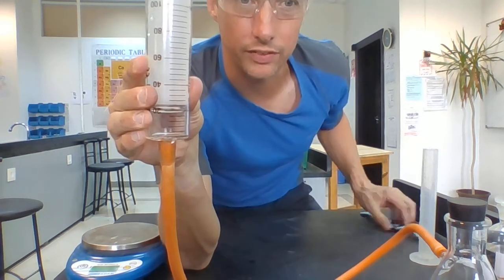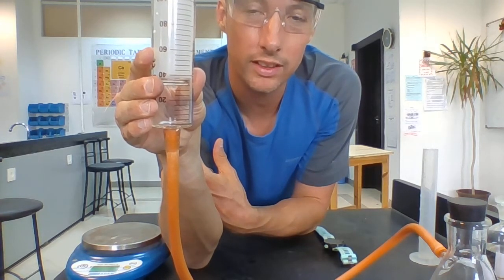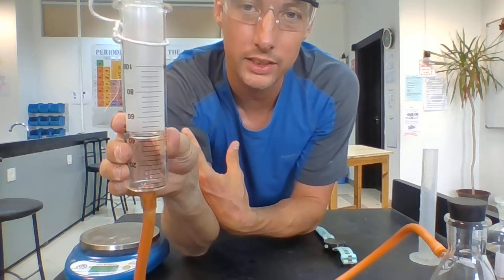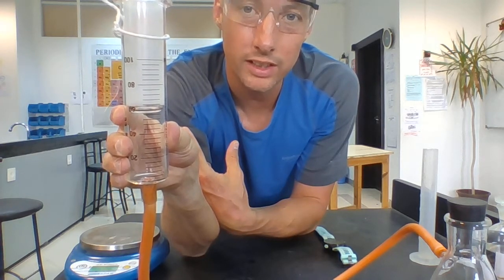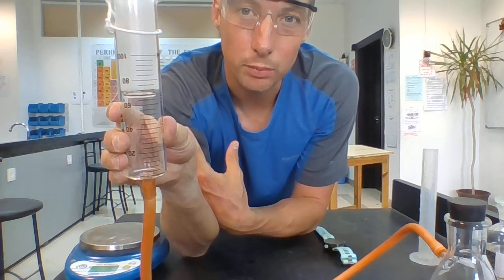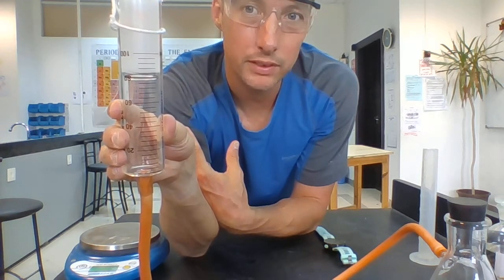So I forgot to start my timer actually, but I start it now. So after 10 seconds, how much would have been left? And after 20 and after 30, and we'll keep going. So this is going to tell me about how much gas is getting produced in a certain amount of time. Now we should normally find at the start it goes up quickest, and then as time goes by, the rate at which it increases gets slower and slower. So we're still going up. It looks like it's slowed down a bit to me.